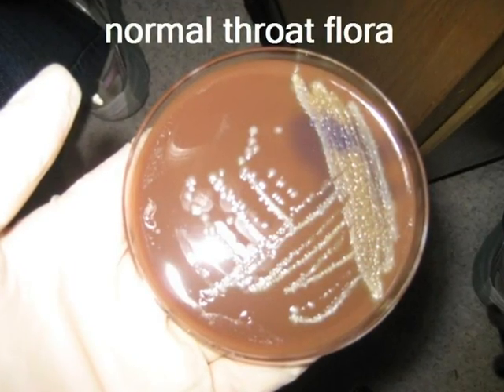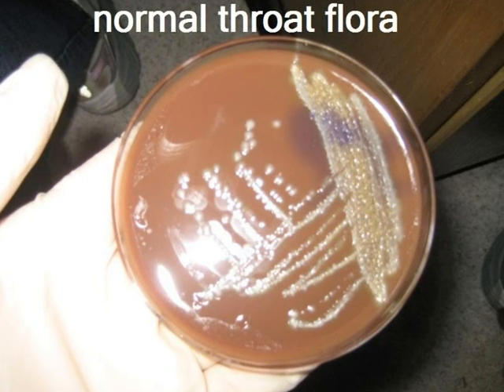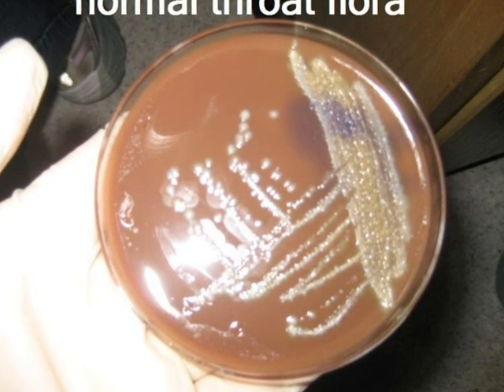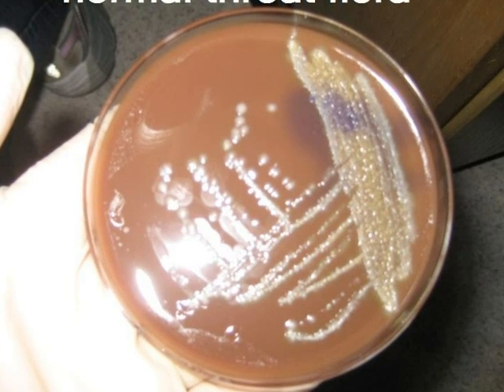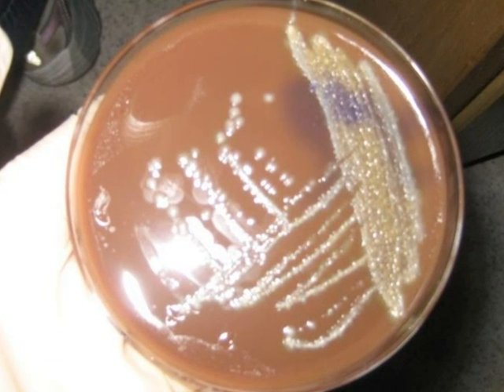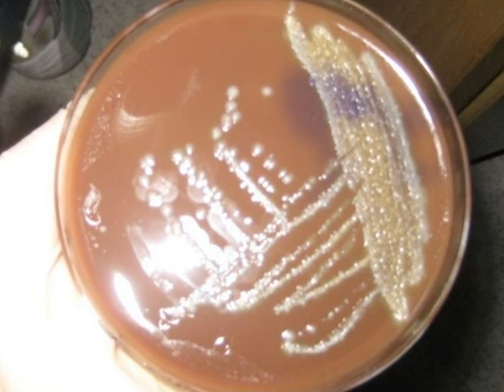This is a normal throat culture on chocolate agar. Chocolate agar is obtained when blood agar base is heated to lyse the red blood cells. Since the red blood cells are already lysed, hemolysis cannot be determined on chocolate agar.